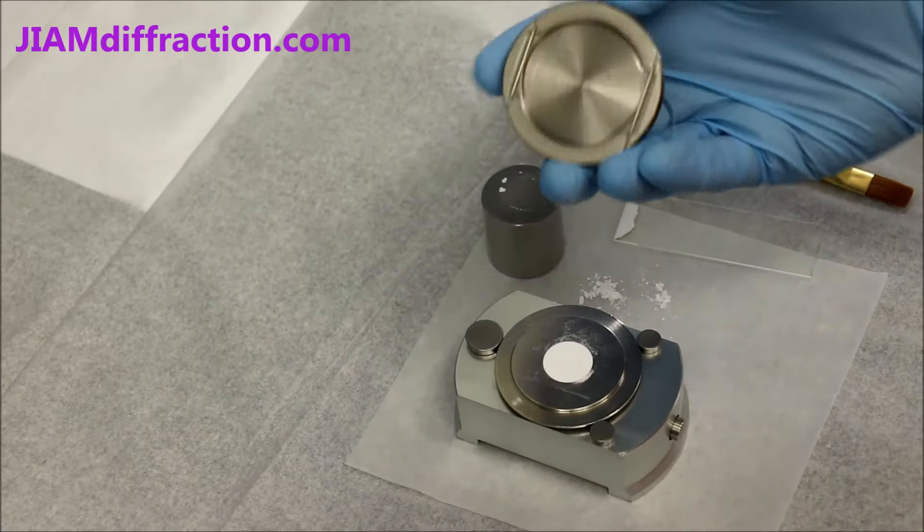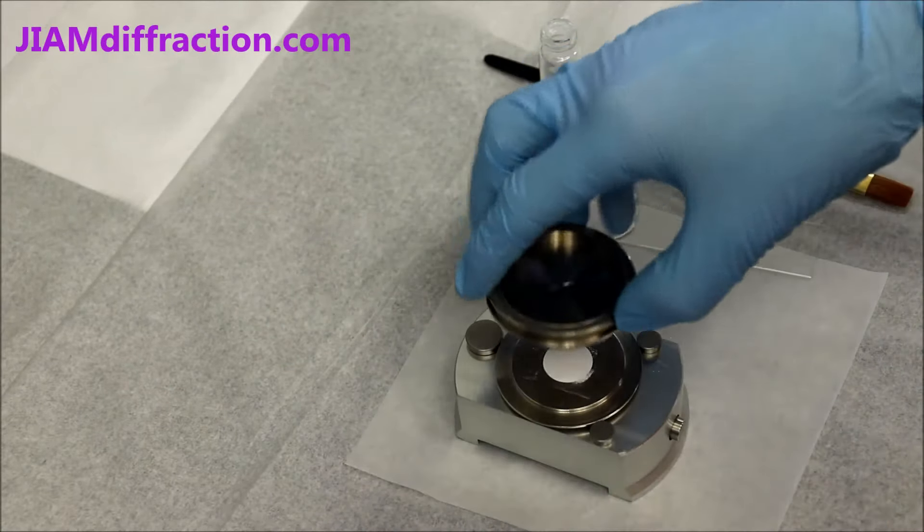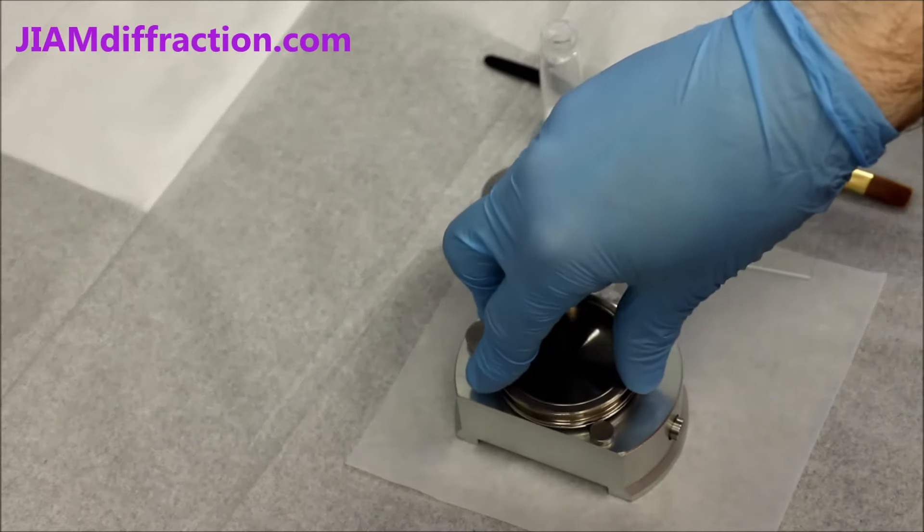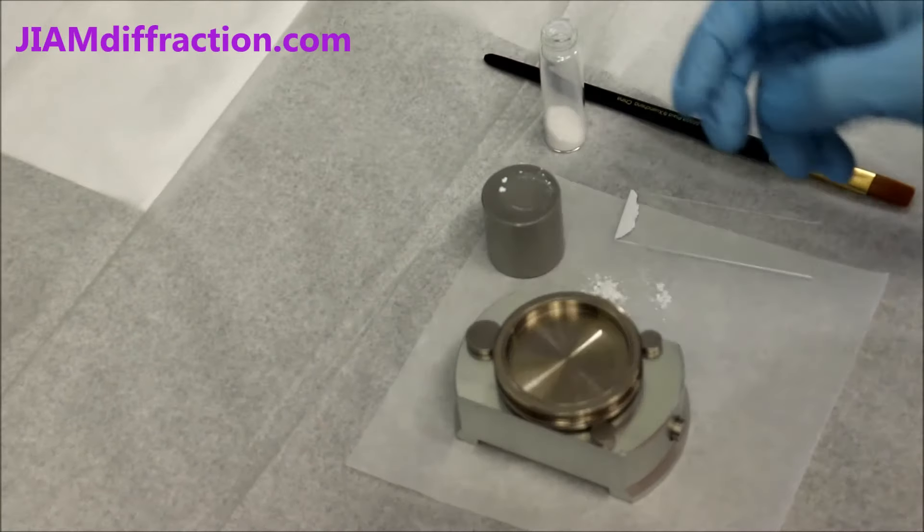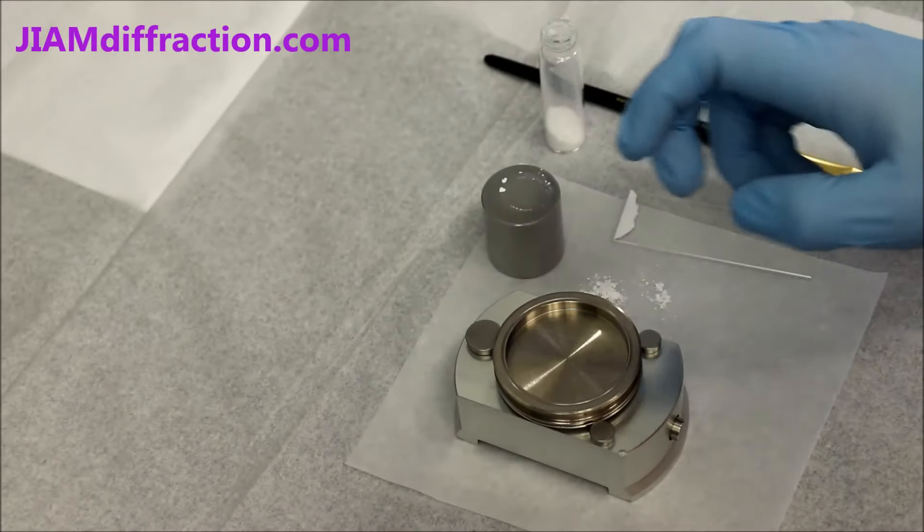Then we want to take the bottom of the sample holder, and with this face down, press down until we hear the click. Doesn't matter which way you put it on rotationally, it's all the same.